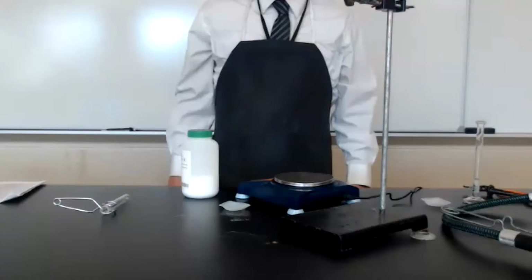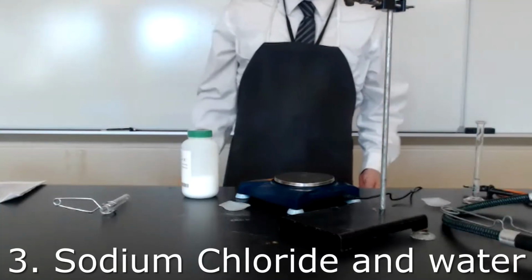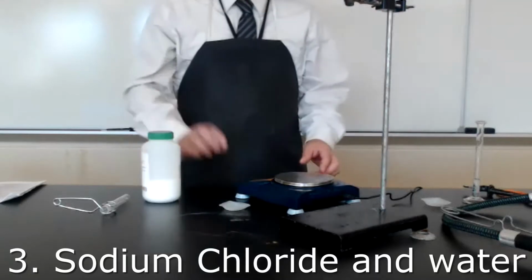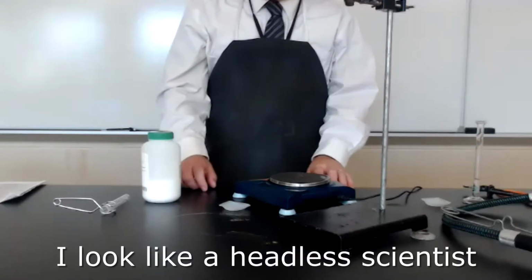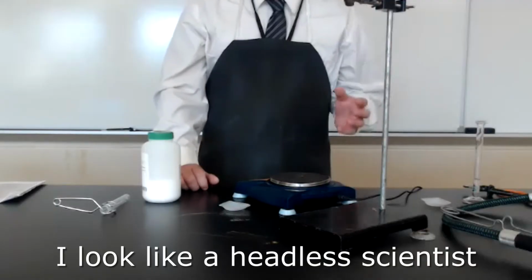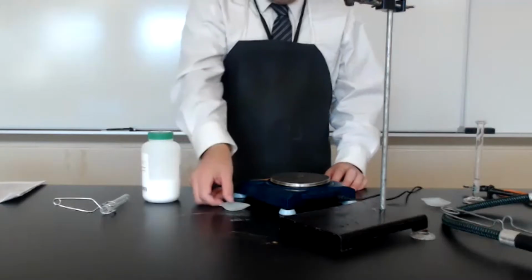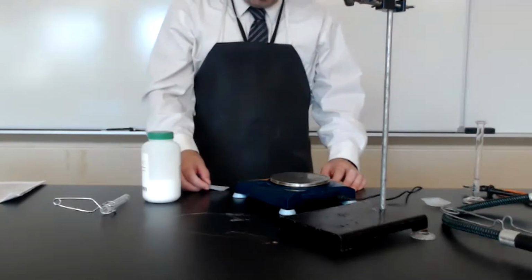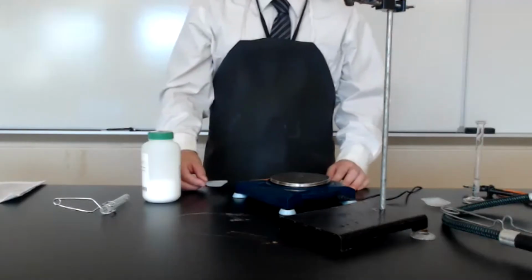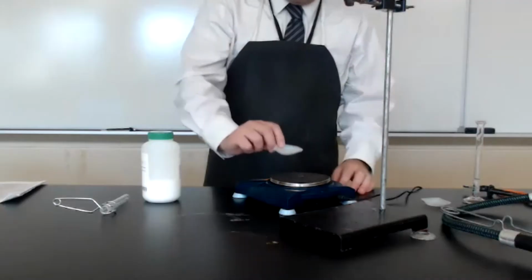For the next part of the lab, we are going to weigh out 1/2 gram of sodium chloride solid. To do this, you'll need a balance. Turn on the balance and wait for the balance to read 0.00 grams. Once the balance is reading 0.00 grams, you can add your weigh boat to the balance.